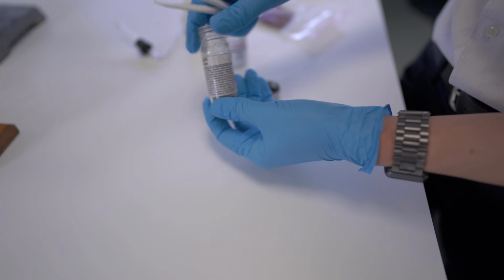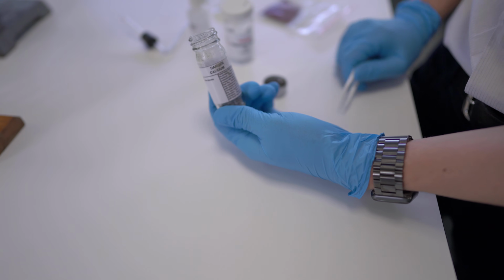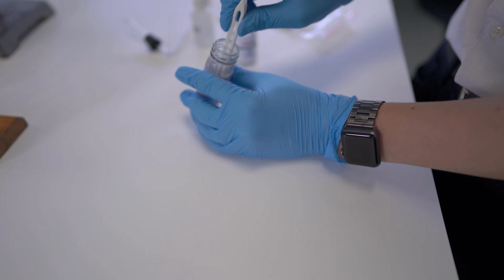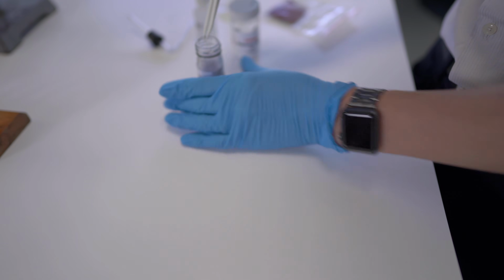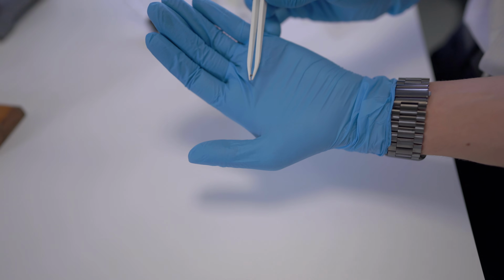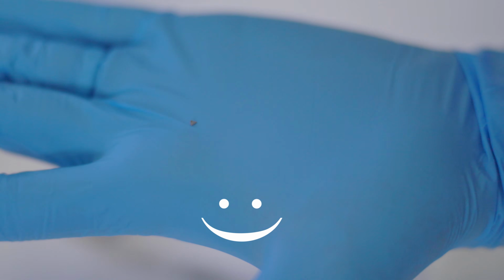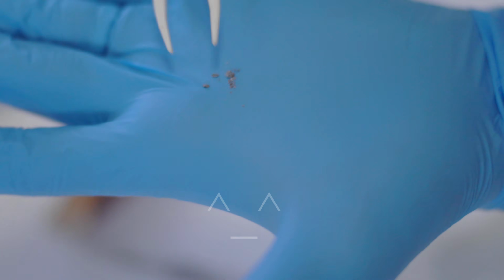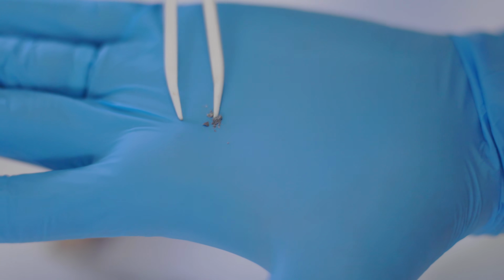We also got some calcium here. Calcium is quite a bit more vigorous in terms of reactivity, so we've got it in a jar here. And we've got very tiny pieces, so these ones are probably not going to show up on camera. We're going to switch our camera to macro mode in a minute, so we'll get a close-up.